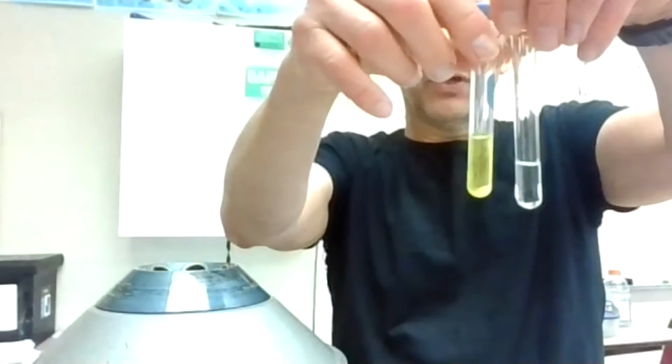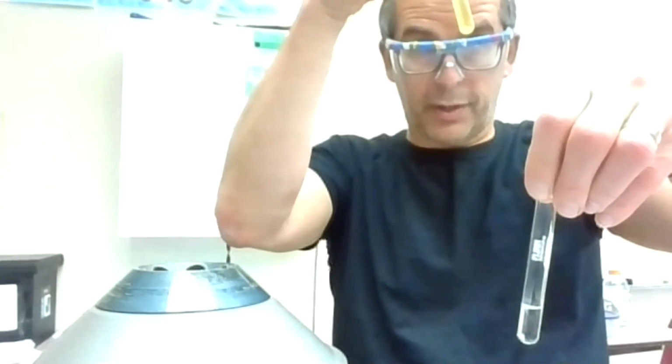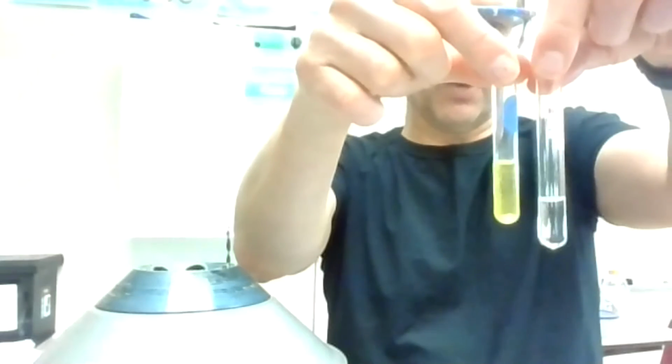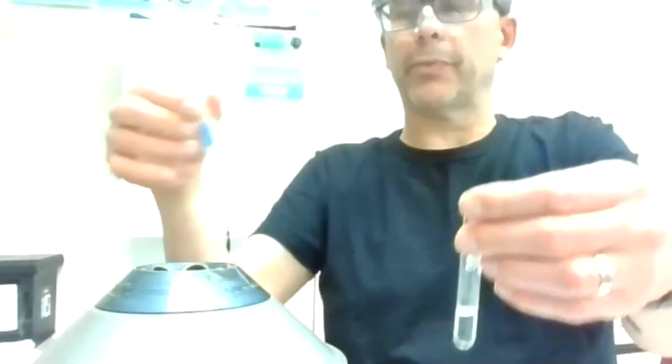Okay, we'll see how that did for mixing things. If you look here, you can somewhat see through, but there's definitely fogginess all over the place on this glass. Not a real strong test, but I think you can see through one a lot better than the other. One right there, and there's kind of a chunk on the bottom too.